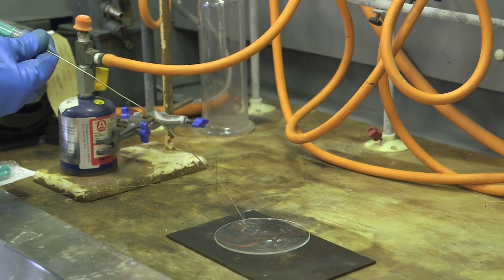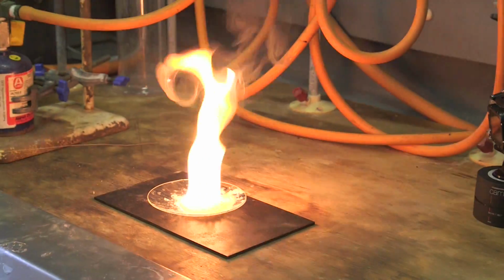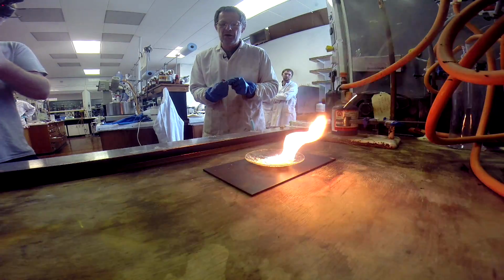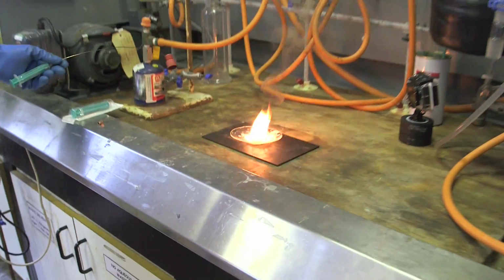Well, let's have a look. Here's some in air, and as you can see, the compound's spontaneously catching fire as we dump it. And in fact, I've put about 2 grams of trimethylaluminium there. That's burning with about the same energy as a 1-bar electric fire at about the same rate. And so you've heard the glass crack there. That's the energy coming out of there.